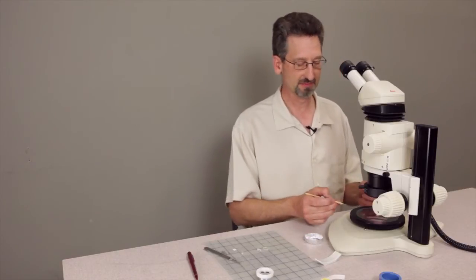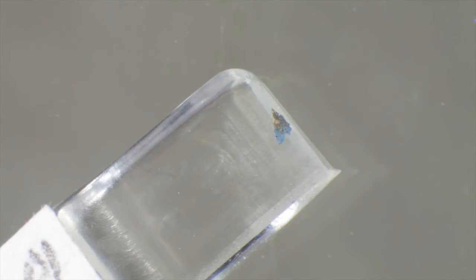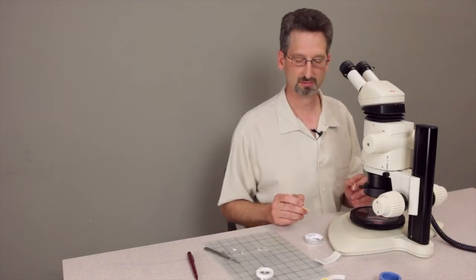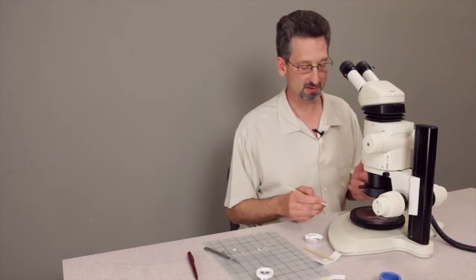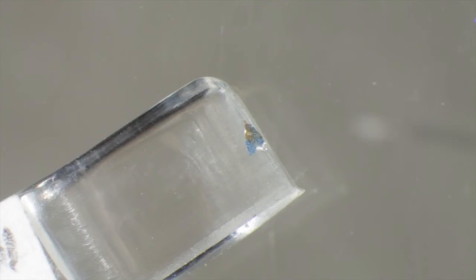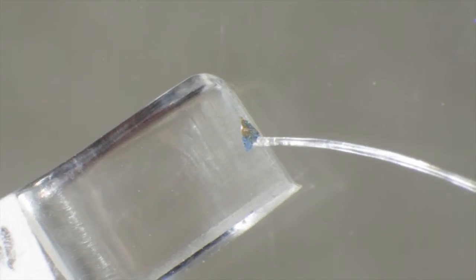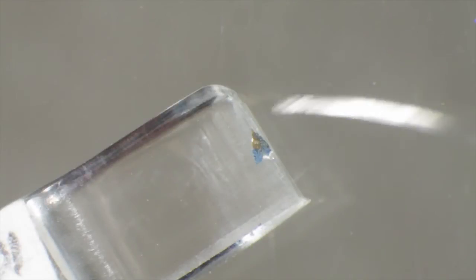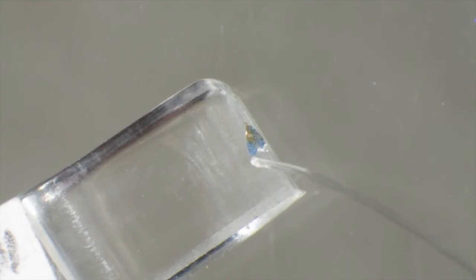So I just pick up a dot and bring it over to the sample and drop the super glue behind or beside the sample position. In some cases I might have to move the sample a little bit more into position with the other tool. Then I test this in a very simple way. I wait 15 or 20 seconds, and if I can use the small tool and push the sample and it doesn't move on the cyanoacrylate coated shelf portion, then I know it's adhered.